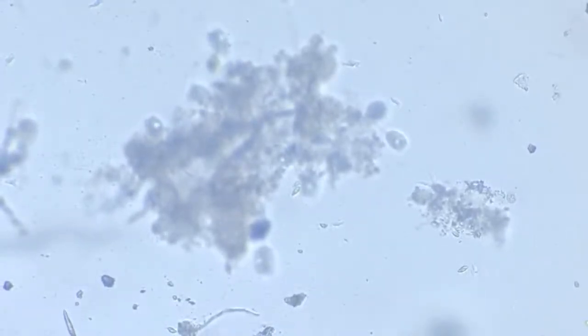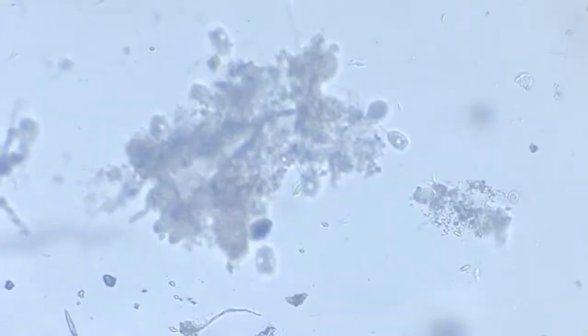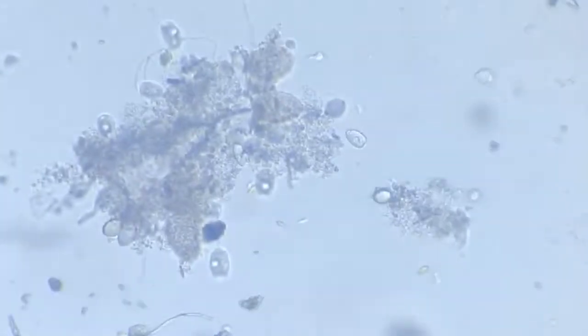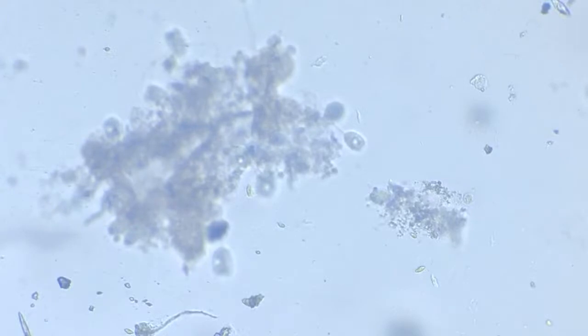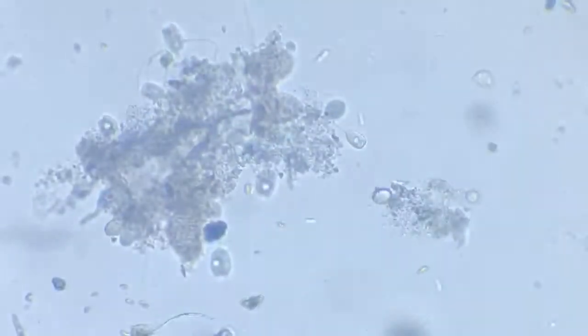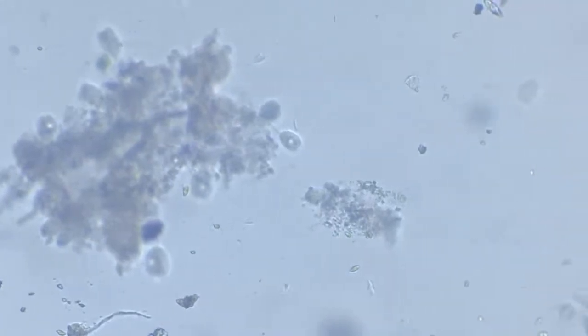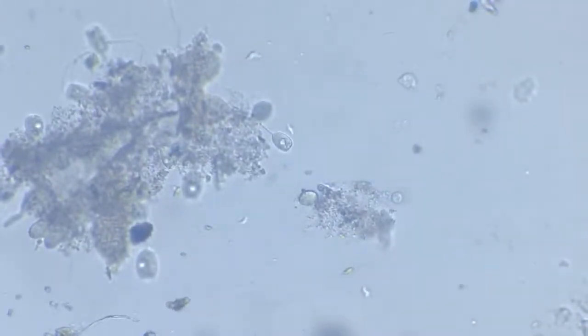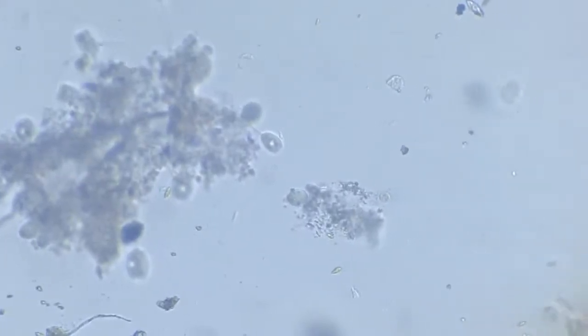but they don't seem to be too active. There are just two, three of them which are active and are swaying. Okay, so we'll focus on this area now, and especially on this center individual. So now we are going to a higher magnification. Refocus, refocus, refocus.